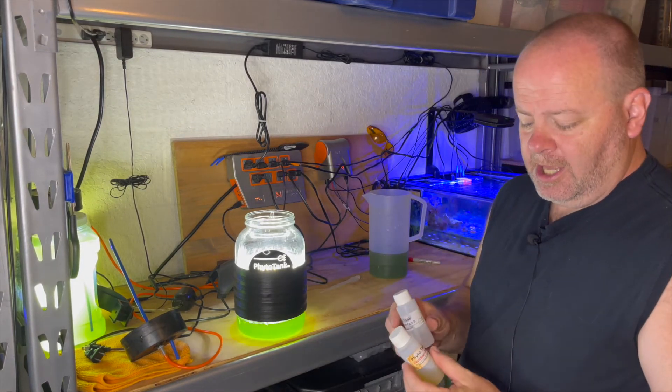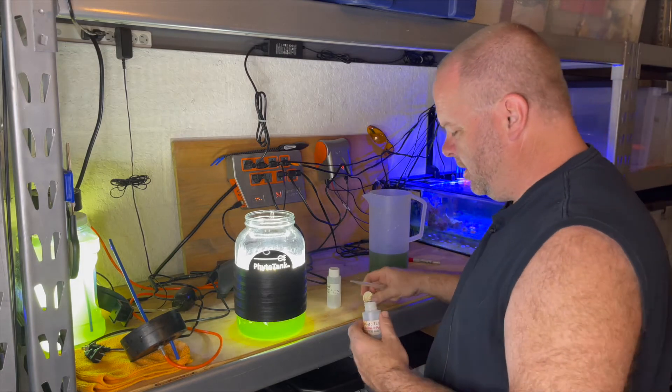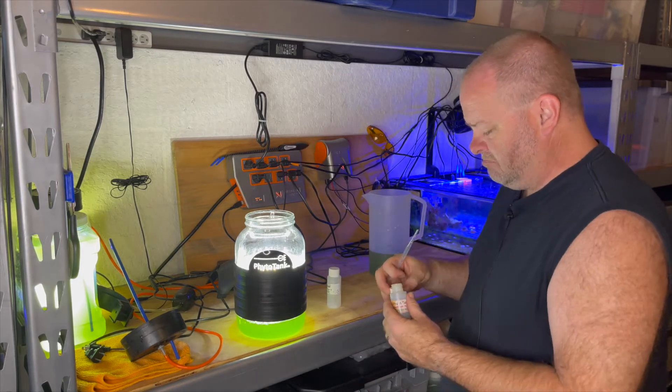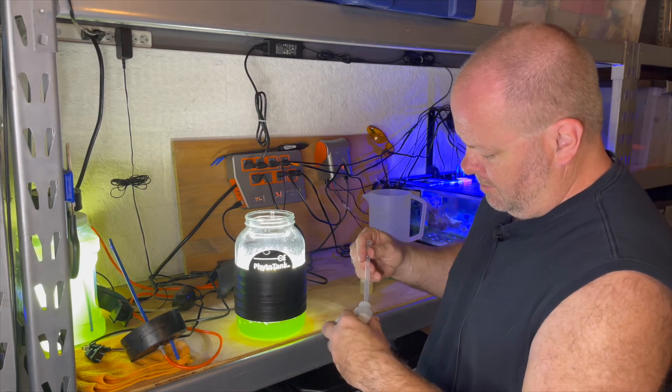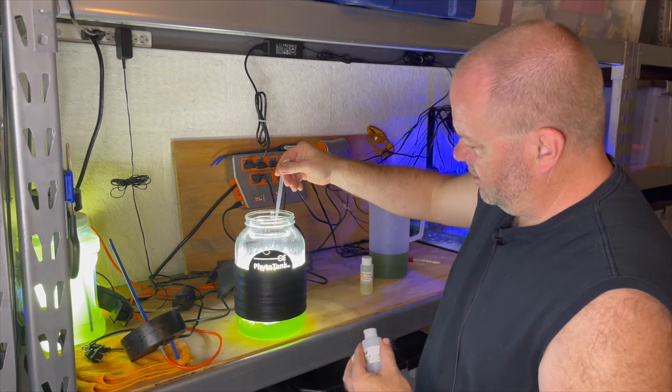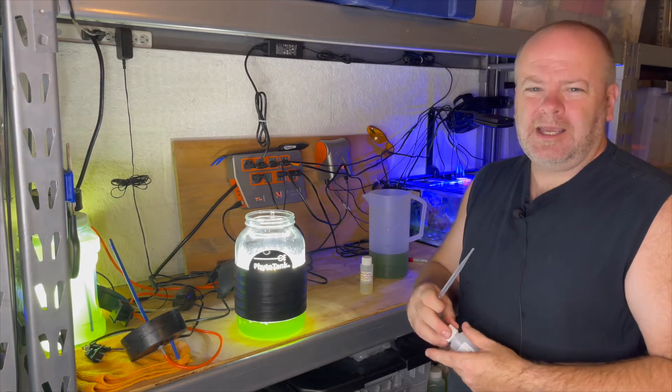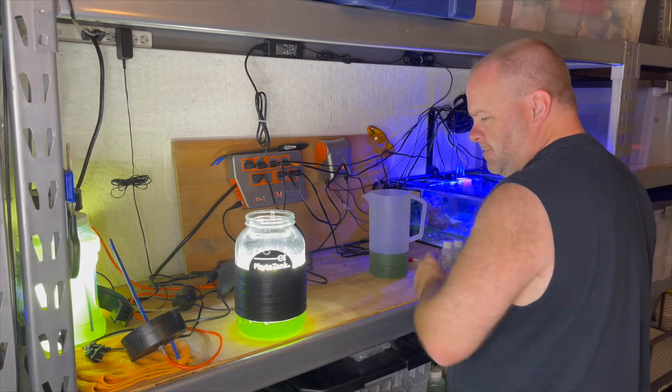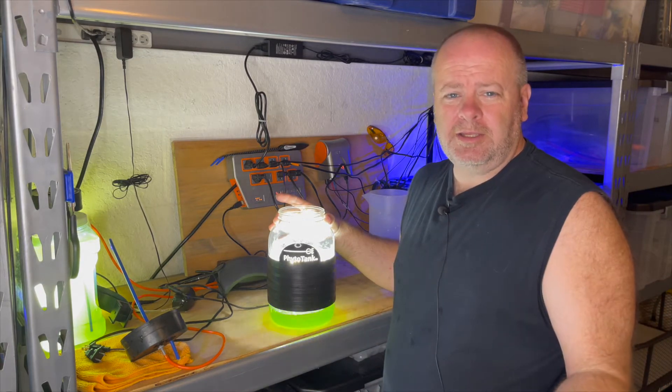The next thing I'm going to do is I'm going to take my part A and part B fertilizer, shake them pretty good. And then I'm going to take, I don't think it matters what order you put them in as just a part A, part B. I know that there are some fertilizer you can get that is just a one part. This particular one is a two part and I don't think it matters one way or another. This just happens to be what I have. And I'm going to put in approximately two milliliters of each. Kind of gauge it roughly. This says two milliliters. I don't know how accurate this is, but the idea is to be pretty consistent with the amount that you're putting in. And I think this is just fine. So I'm going to put those to the side. And then the next thing I have to do is add salt water into this. And unfortunately, I've got to go off camera again to do that, but I'll be back in a minute.